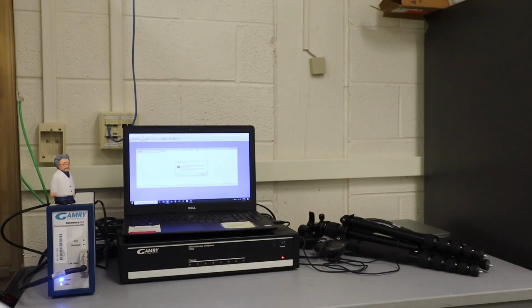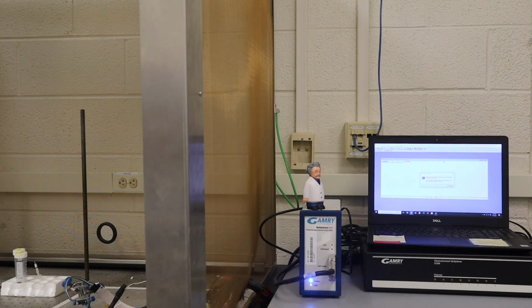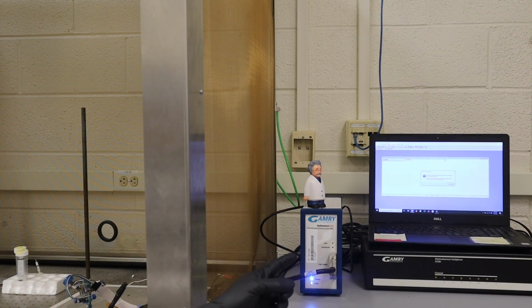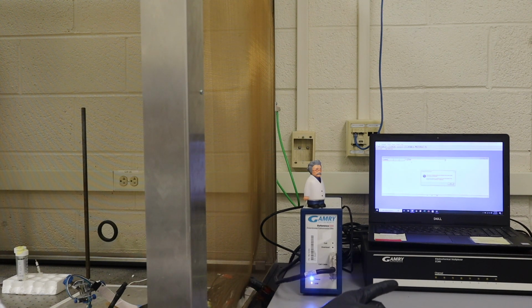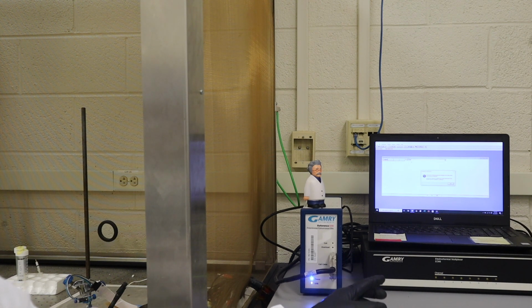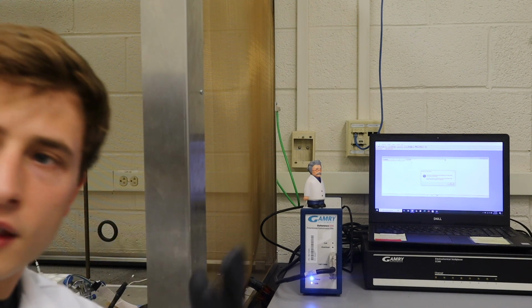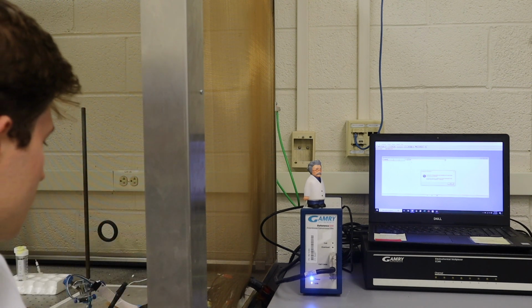But briefly, this is our setup, generally speaking. We have our potentiostat for our electrochemical measurements here. This black box here is the multiplexer. So our potentiostat that we're using is the Gamry Reference 600, and our multiplexer, this black box here, is the ECM8 electrochemical multiplexer, and that allows us to look at the function of up to 8 channels in order.